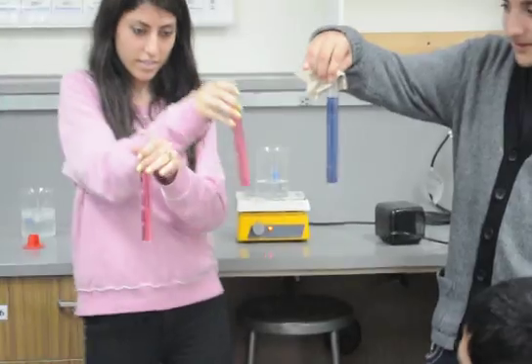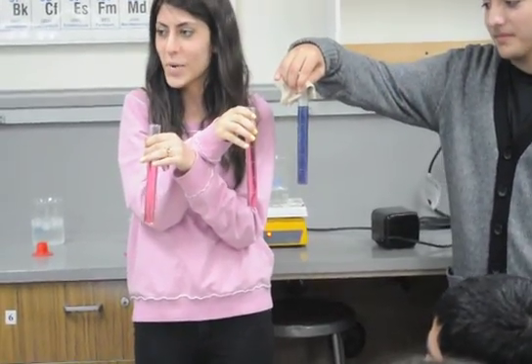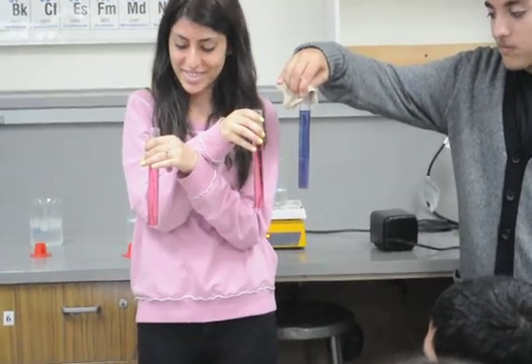Okay, there we go. Alright, now we can see the comparison of the colors as they've done their shift.